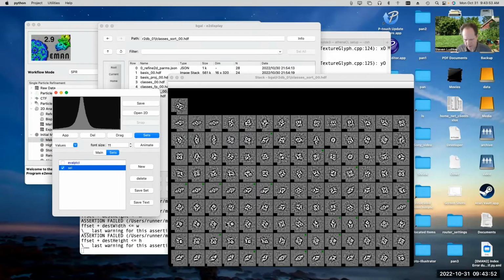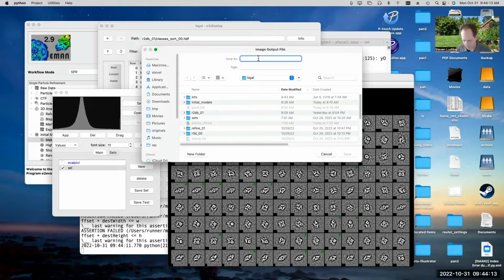It doesn't seem to affect other programs, like when you do the 2D plots and you drag around, the fonts seem to work correctly there, but they're still broken here. So I don't know what's going on with the black boxes thing. I need to take some time and look at it. Anyway, once you have picked the subset of particles that you want, you hit the Save Set button, and then you can save them to an HDF file.